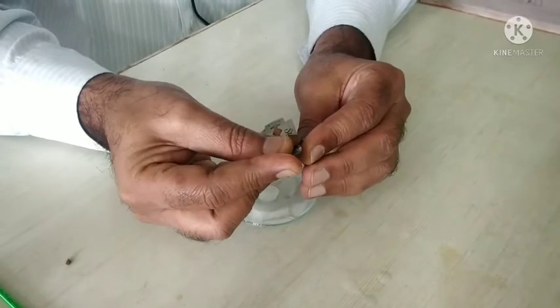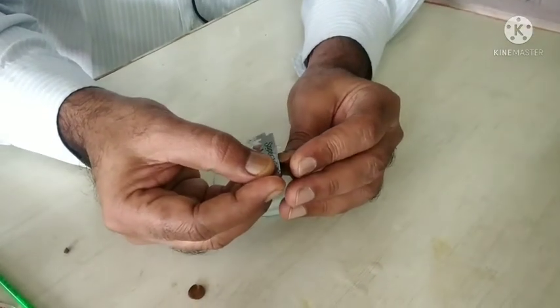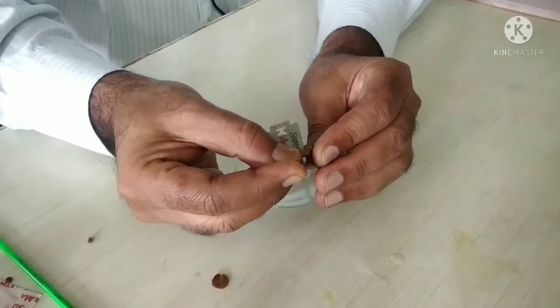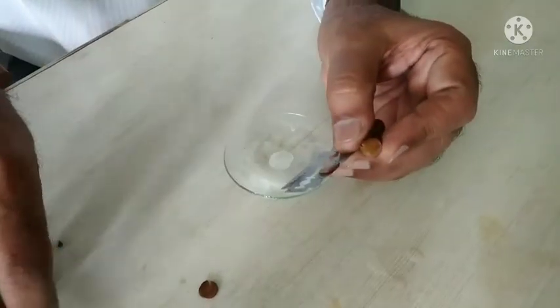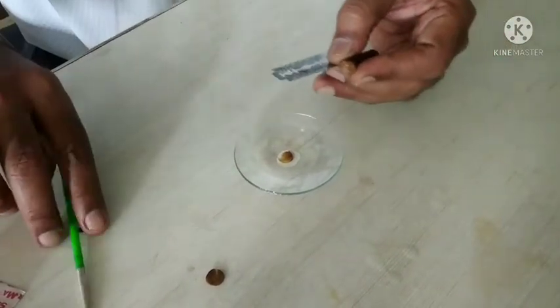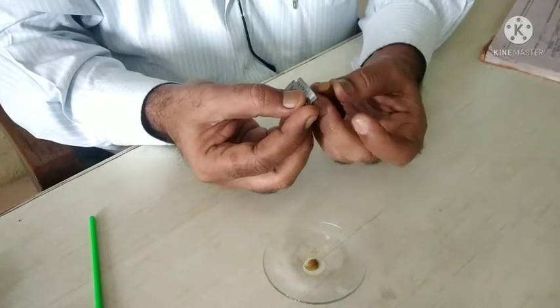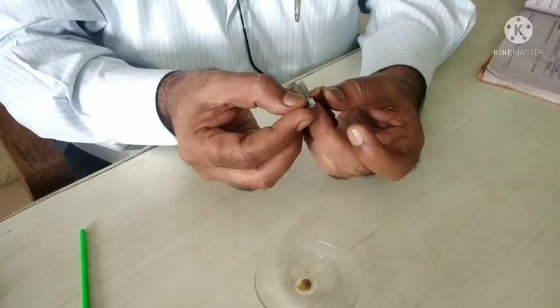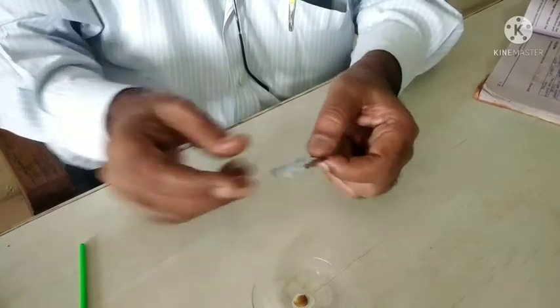Then we take a thin transparent section of the unpeeled licorice root by cutting it uniformly. You have to use a sharp blue razor blade for taking a thin transparent section.